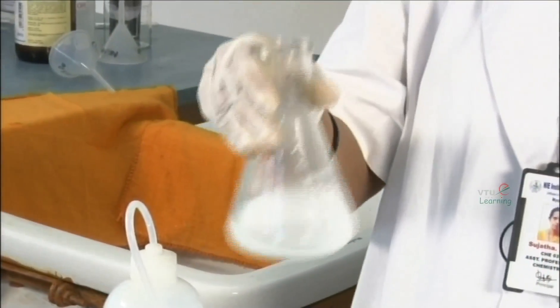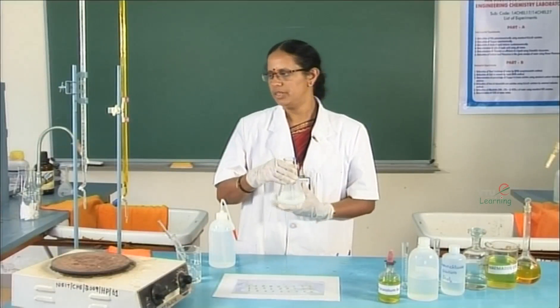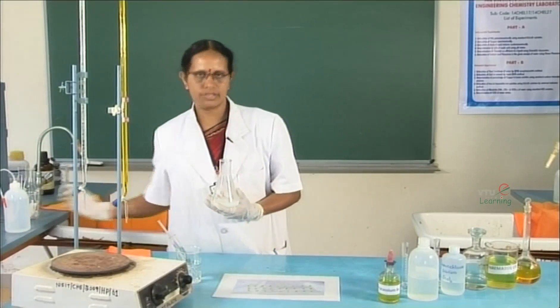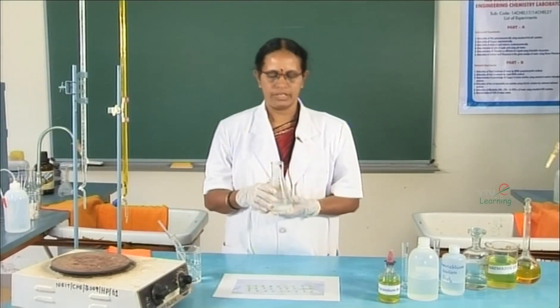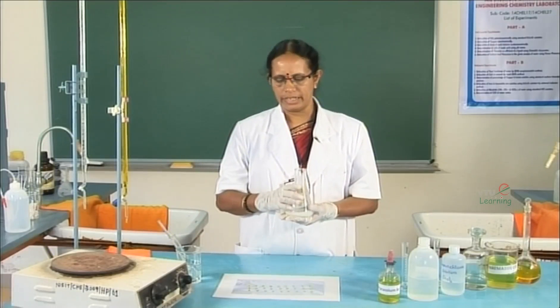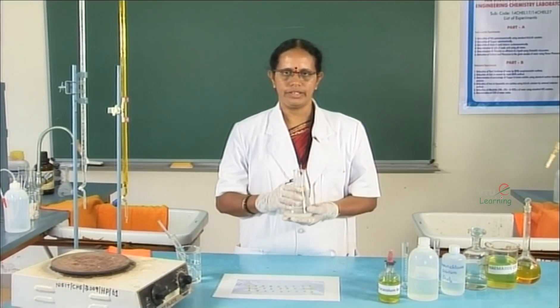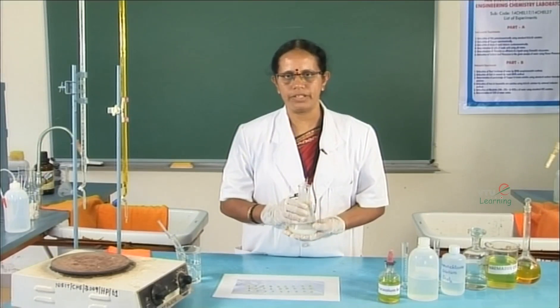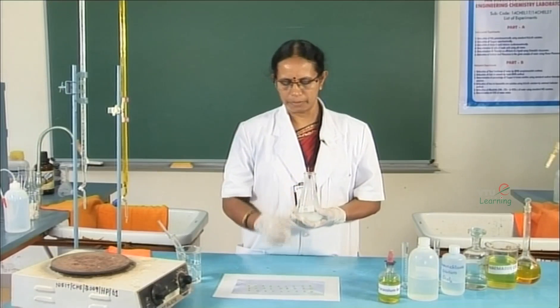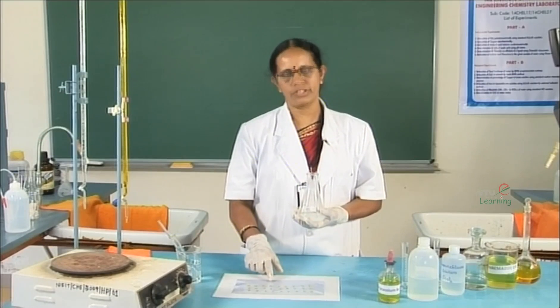This solution has to be titrated against potassium dichromate solution which has been filled in the burette. This experiment is conducted by using an external indicator, and the indicator used is potassium ferricyanide. The indicator has to be placed on either the indicator plate or the polythene sheet as shown.